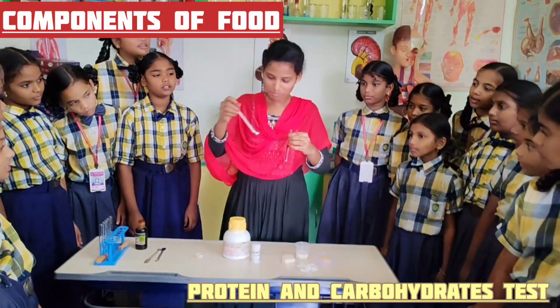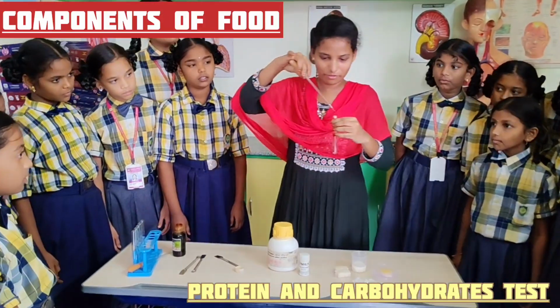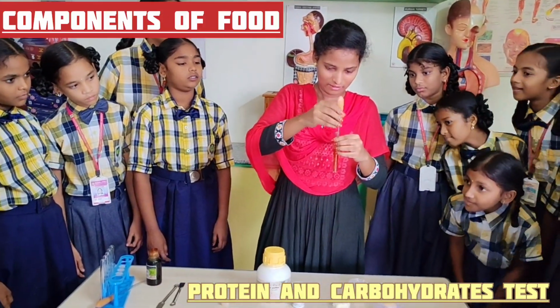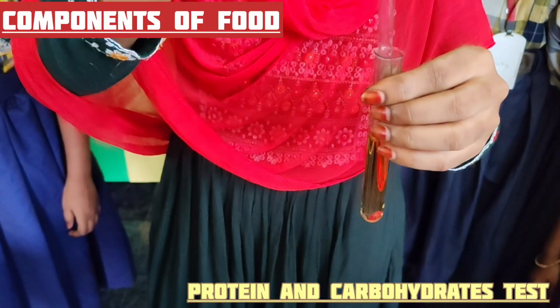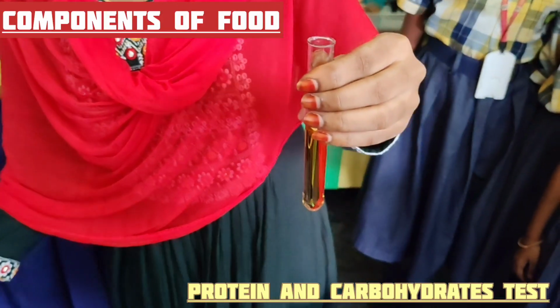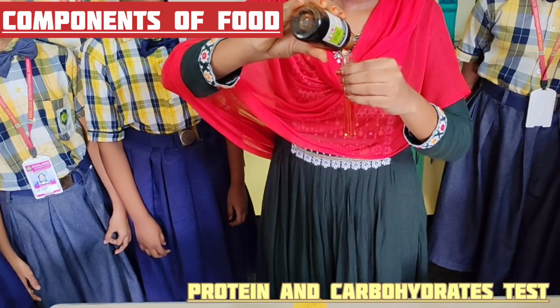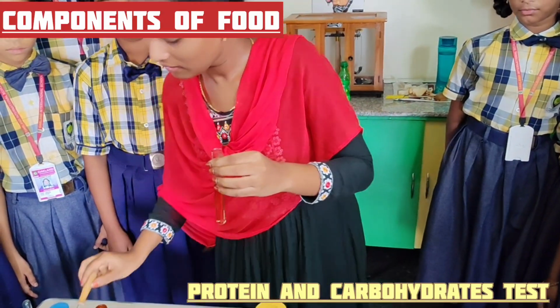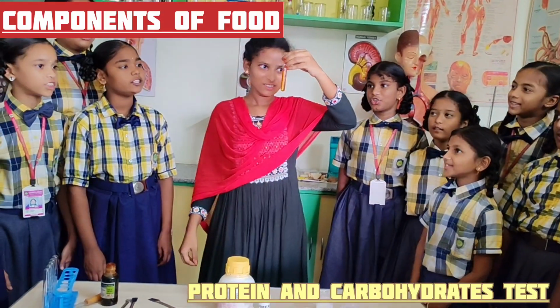Then a completely dissolved iodine solution will be formed. We have to stir. So, it is iodine solution.